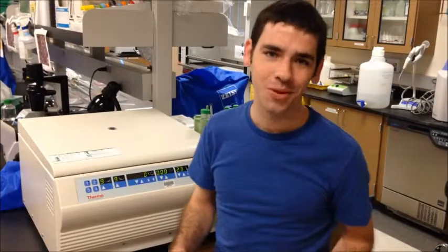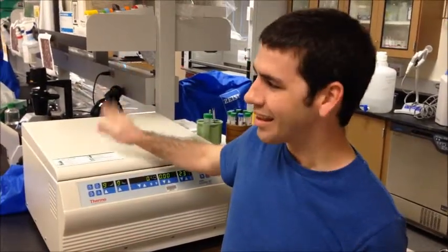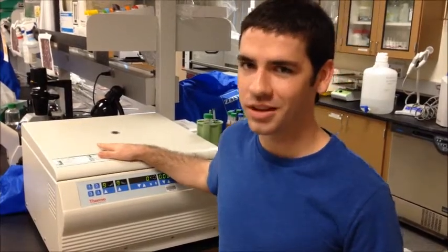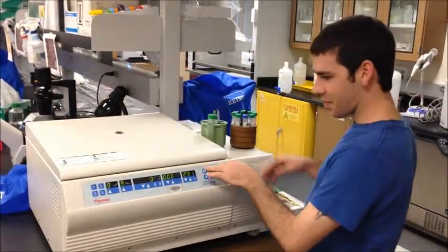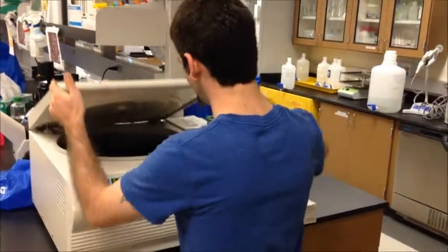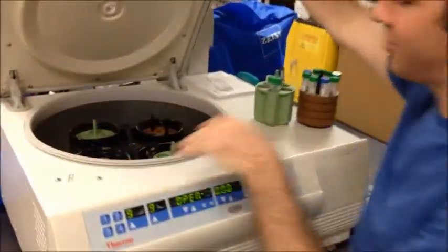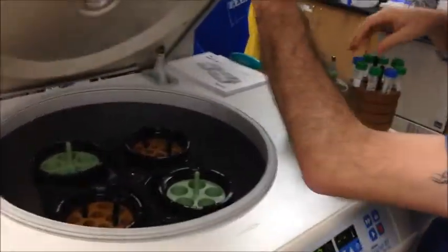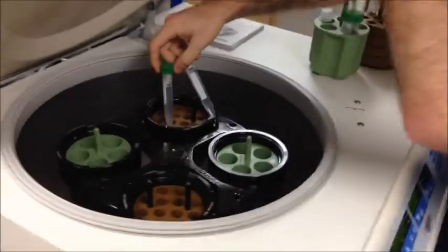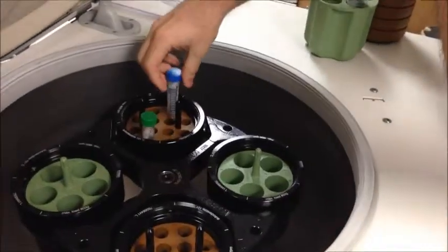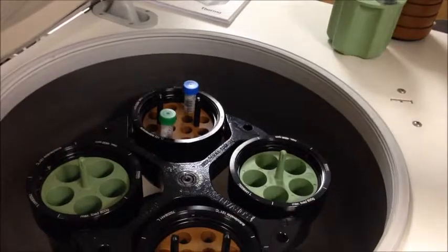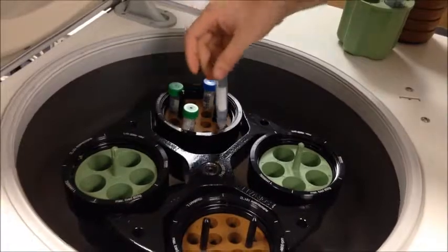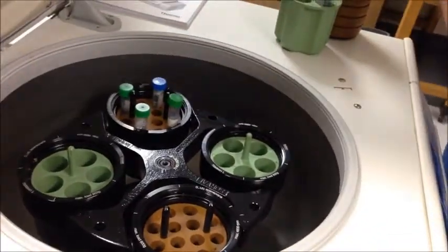Alright, so balancing is very important. I guess if I were to use that same technique I used on the little one, on this big expensive one here, I'd probably lose my job. So looking in here, I see there's different adapters. I suppose that's what they're for, to help in the balancing. So we've got smaller tubes, we want to have them balanced to each other, so it spins regularly. The more I put in there, I have to balance everything, so nothing bad would happen.